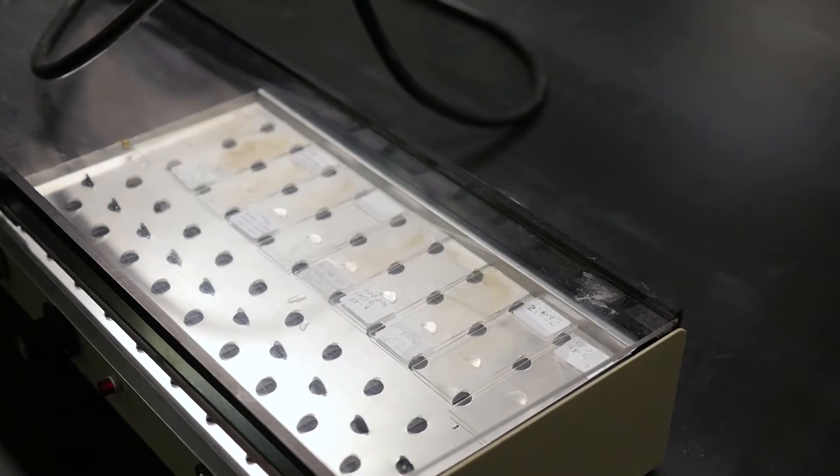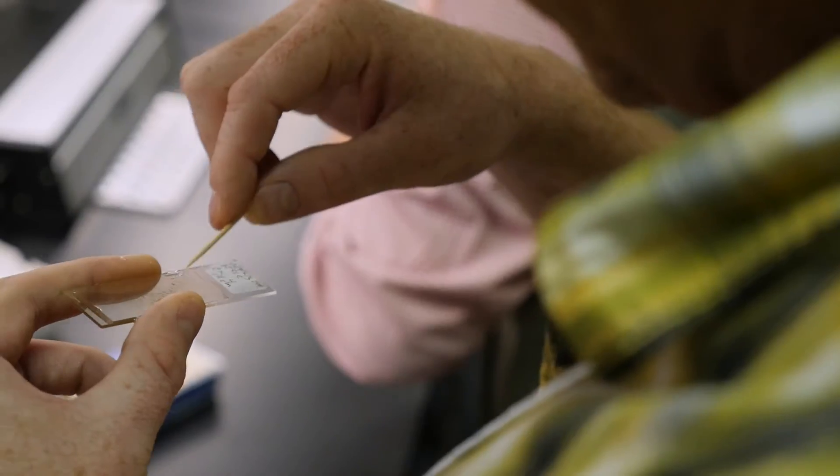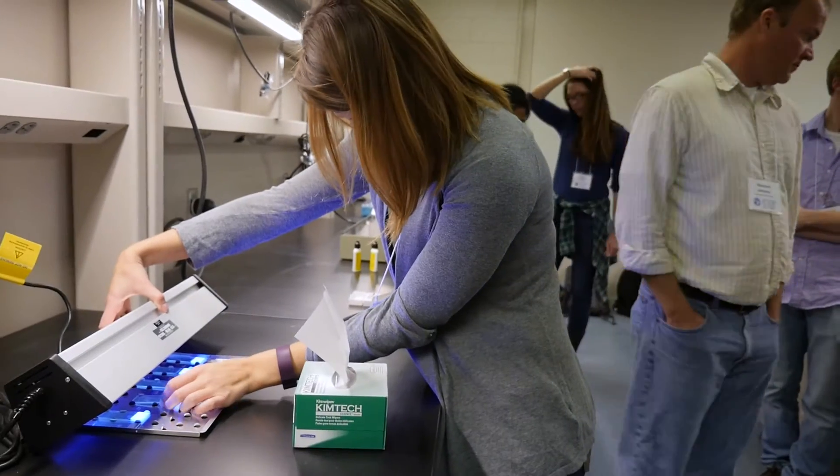So these take a double dose of optical adhesive, okay? You can do it. Just set it on top there. And you'll notice that just with gravity, the weight of the coverslip pushes down.